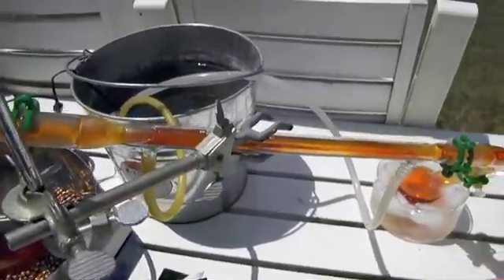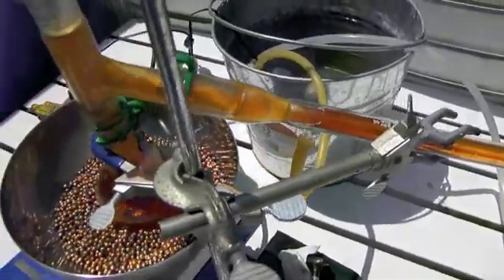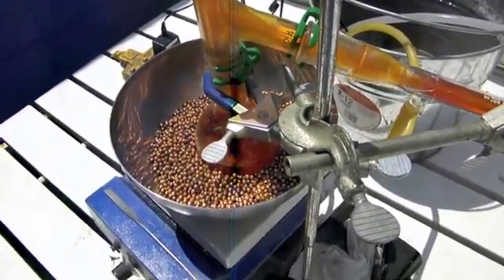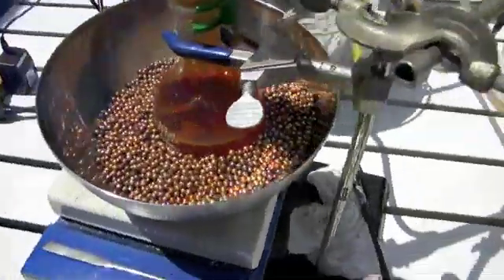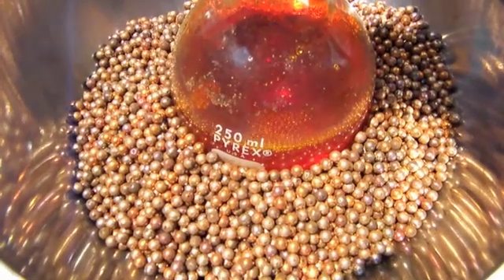In the final step, I disconnect the apparatus, clean it out, and I recover the bromine in the recovery flask and ampule it. As the cleanup and ampulling of the distillate is not particularly interesting, and ampulling will be in its own separate video, I present to you the completed ampule of bromine that we recovered from this reaction.